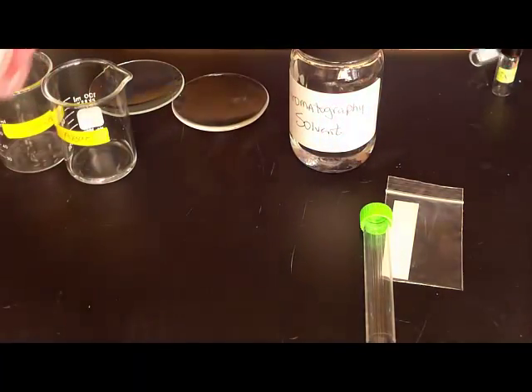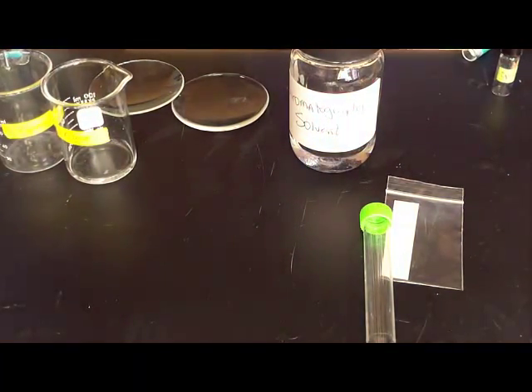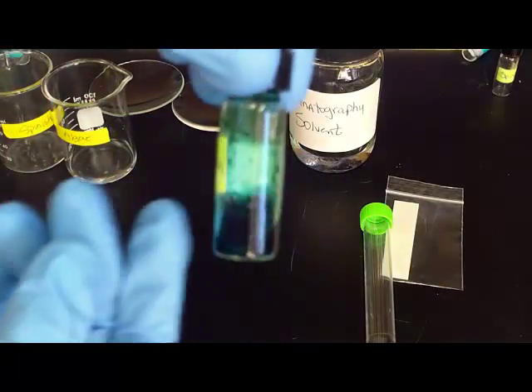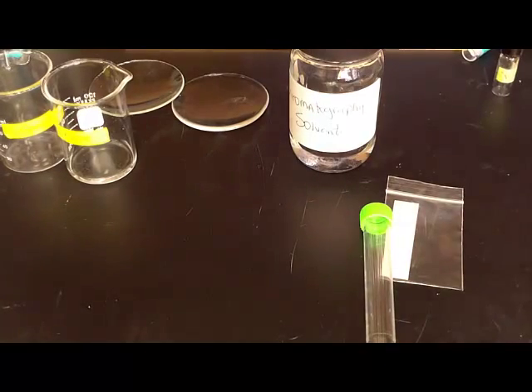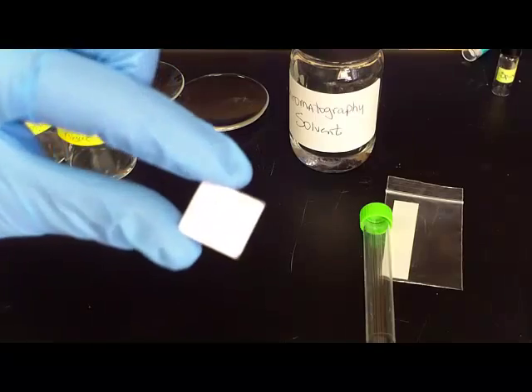Before you do your testing we're actually going to have a sample of just some food coloring and everyone in the group will do a sample. I have small little squares that look like this.